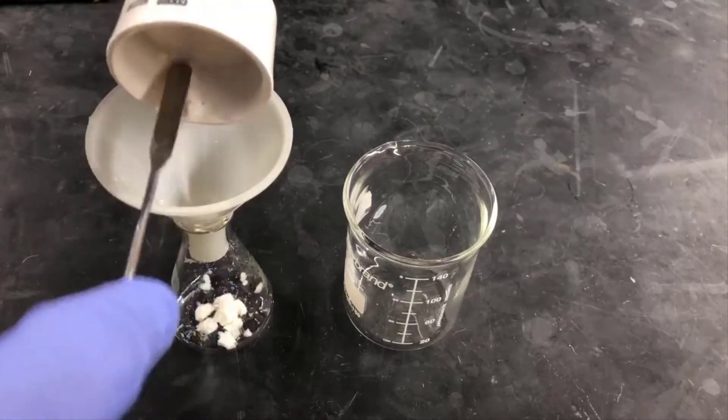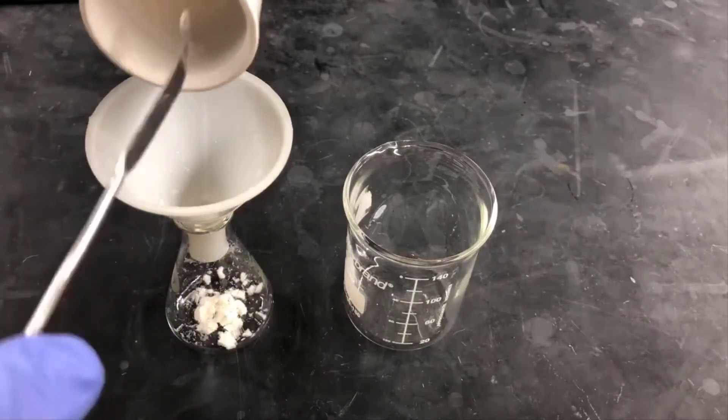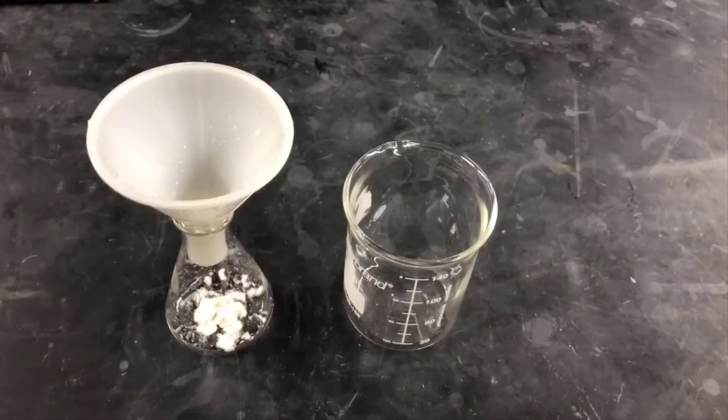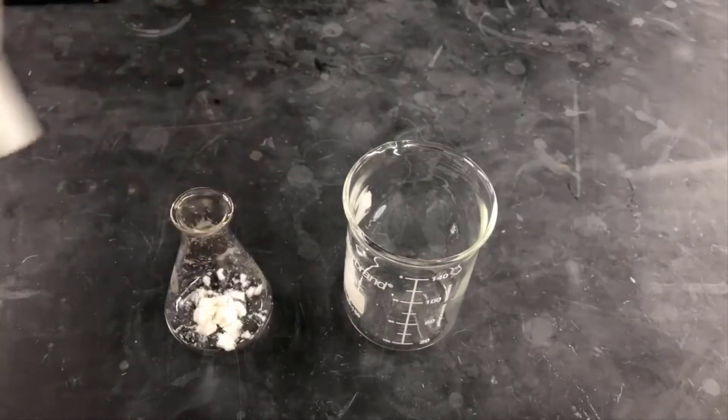I'll be using a mixed solvent system for this recrystallization. That involves using a good solvent, xylene, along with a poor solvent, petroleum ether.